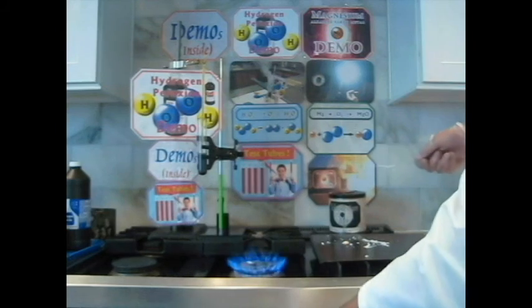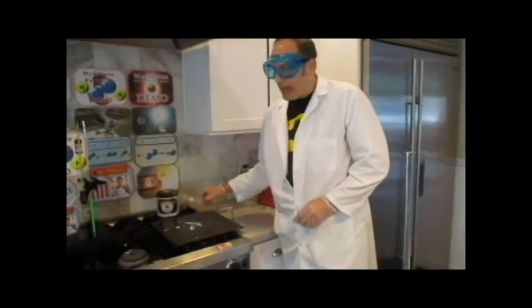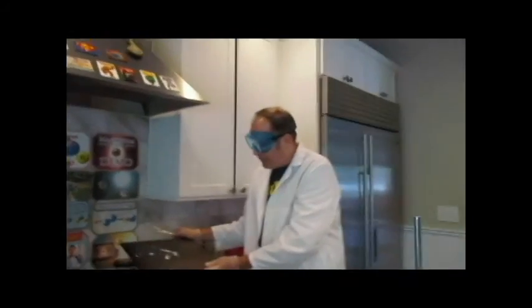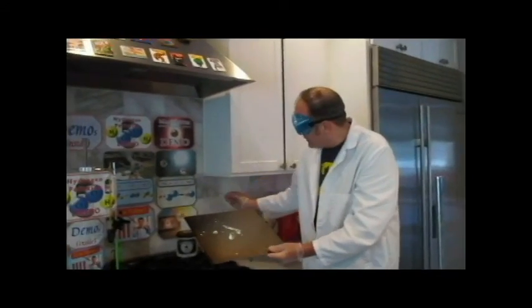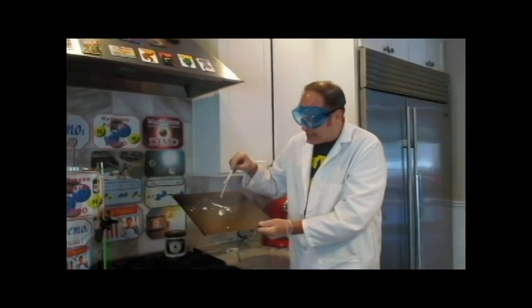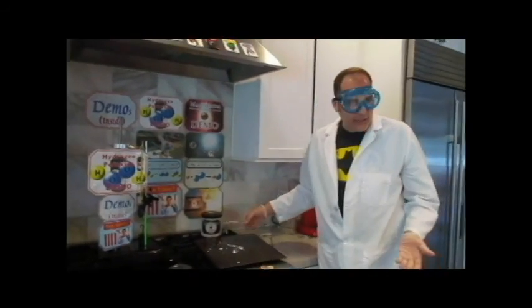Let me shut off the stovetop. And notice how bright that was. Depending on your distance, I'm a little dazzled right now myself. That was as bright as the sun, and I did 2 ribbons, so it was kind of like a binary star. Well, there's the magnesium oxide. Lots of chemicals oxidize, and then they form compounds with oxygen. Lots of chemicals react with oxygen.